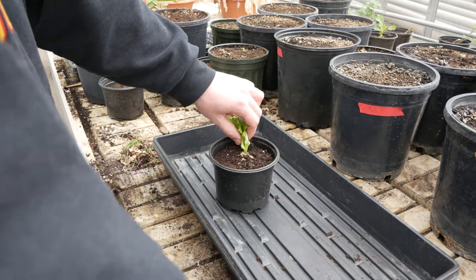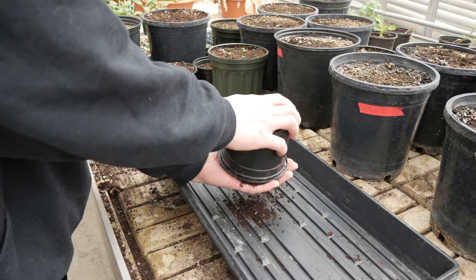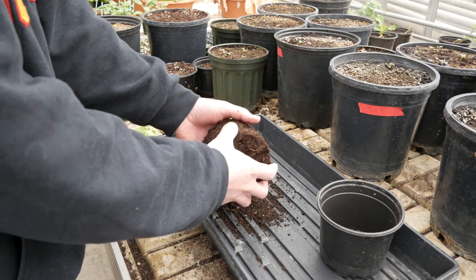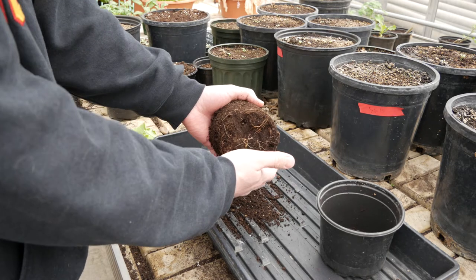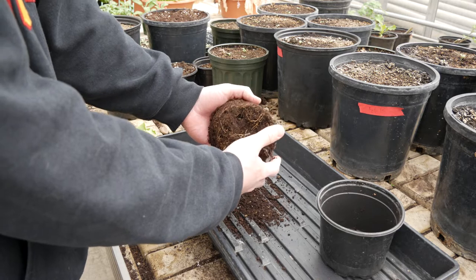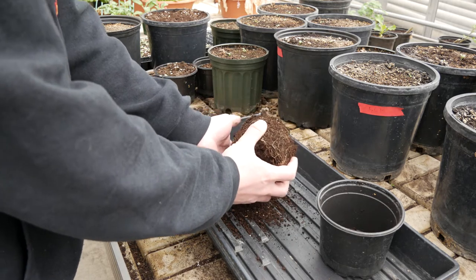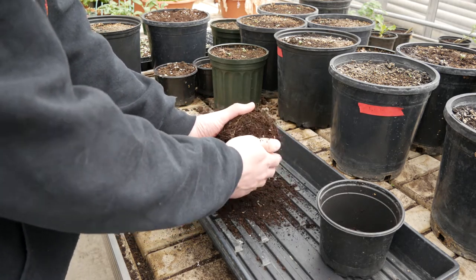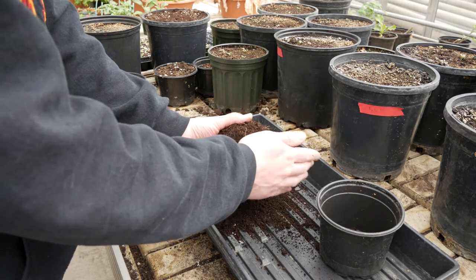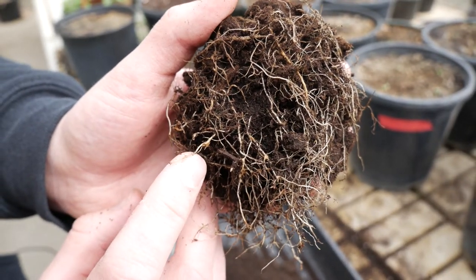The first thing you want to do is clip off any above-ground plant tissue or plant material, and then tip over your container to expose your roots and soil. You also want to dry down the soil a little bit before this extraction process because if it is wet, it's going to make the whole process more difficult. Once your root system is exposed, start tapping away on the soil to release it, and just by doing this I can see that the roots here have some galling from root knot nematode parasitism.